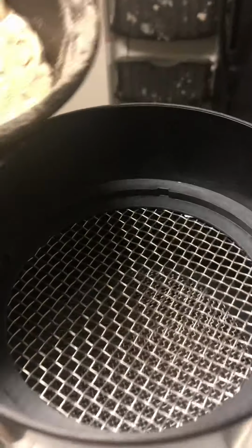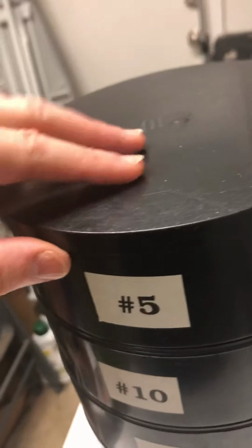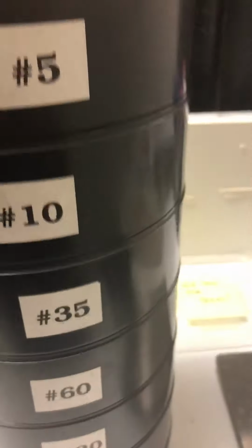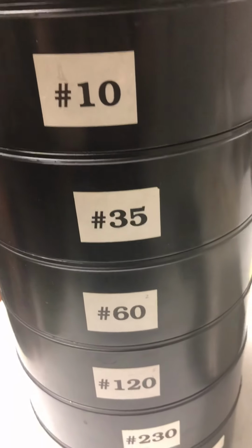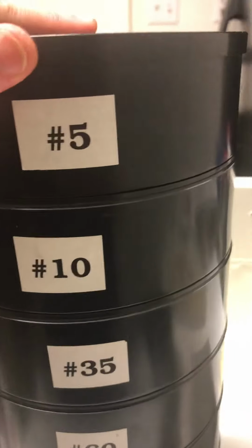We get to pour the sand into the sieve. Make sure we get all of it out. You can see I've got some fragments left in there. So I got all of that out. Put the lid on so none spills out. And now, shake. We shake in order to make sure that any particles that can pass through the screens do pass through the screens. At this point, we'll take our first sieve.